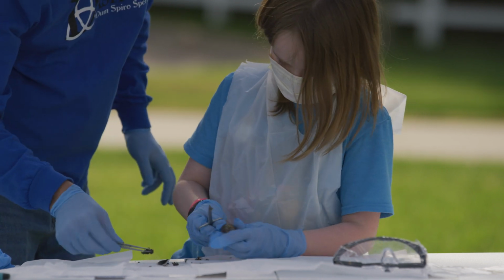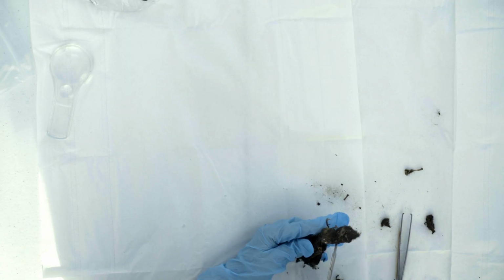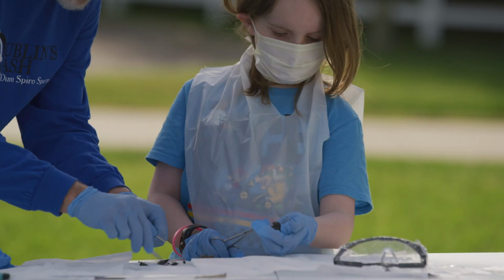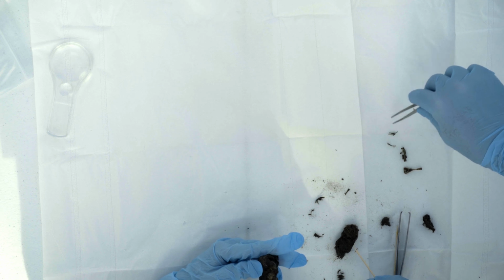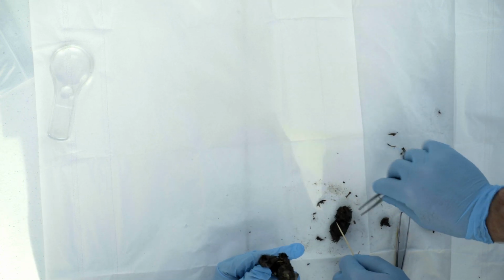I'm going to take a big piece off of here. Oh, that's a big piece. See any bones in here? Yeah, sure do. Look, there's one right there. Here's a bone. So, can you explain what we're going to be doing with these bones? Well, sometimes what people do is they will take all of these little bones and they will try to put them on a chart and try to figure out exactly what animal this was.